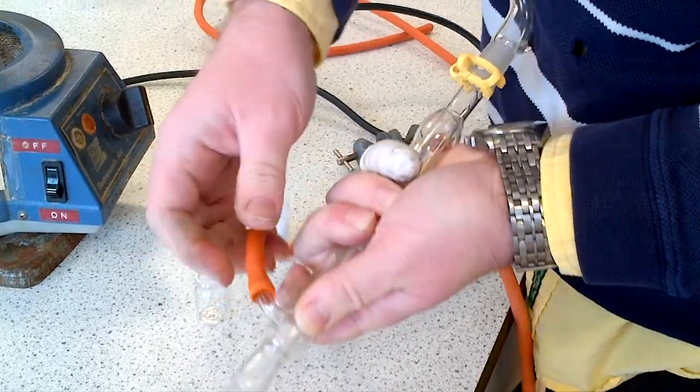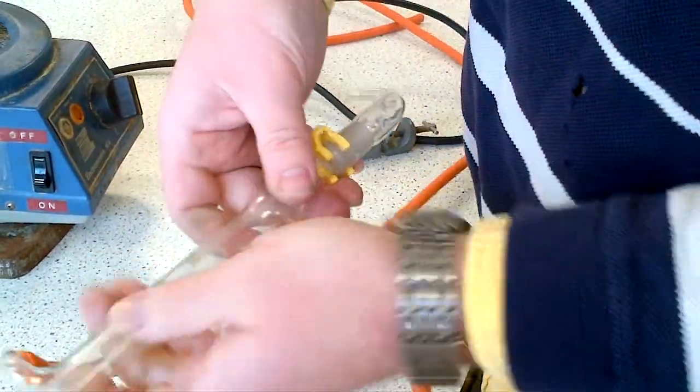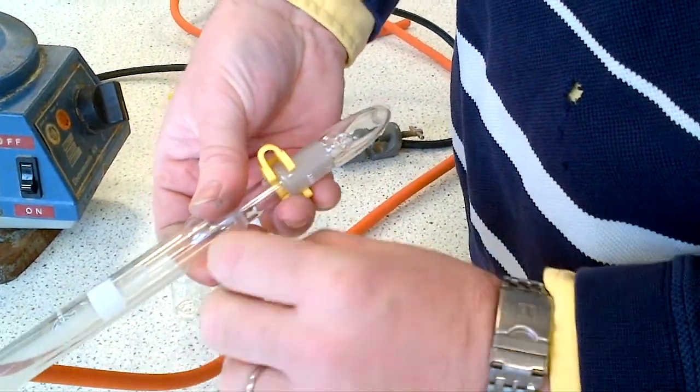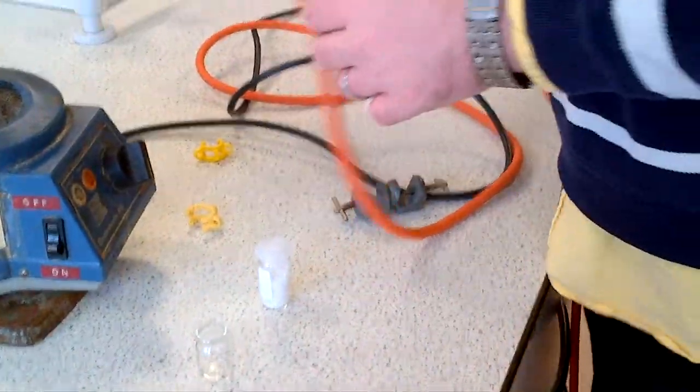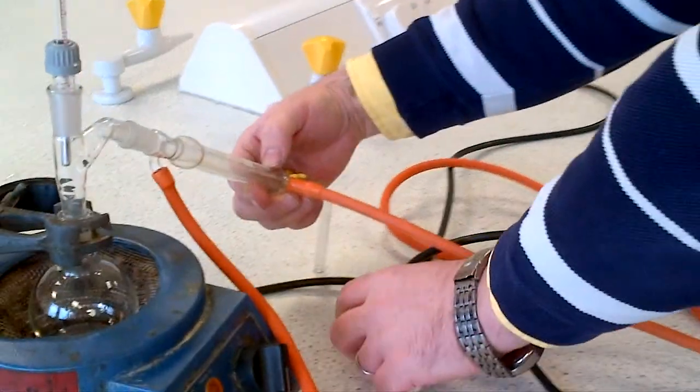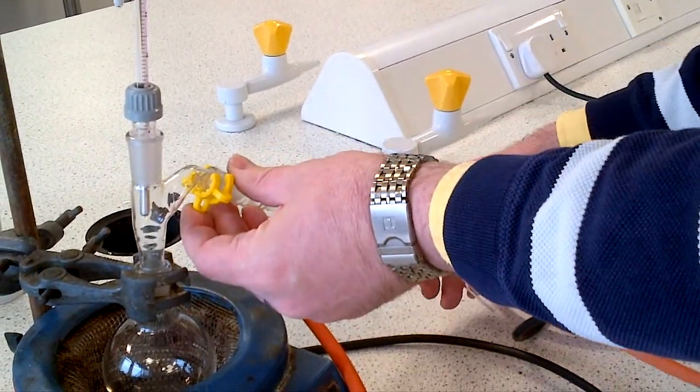For some distillations, if you're leaving it overnight, it might be better to wire around the tubing onto the joint to make it secure. Put it back into position and clip together as appropriate.